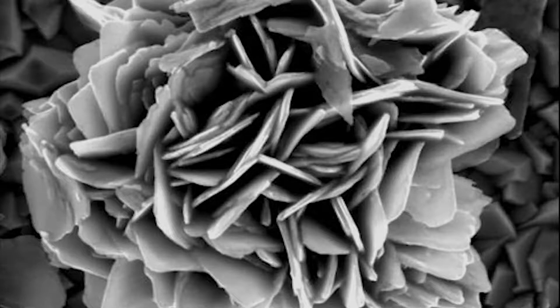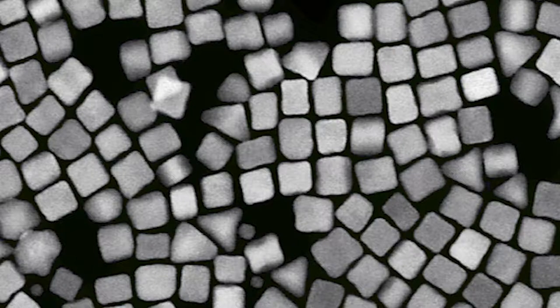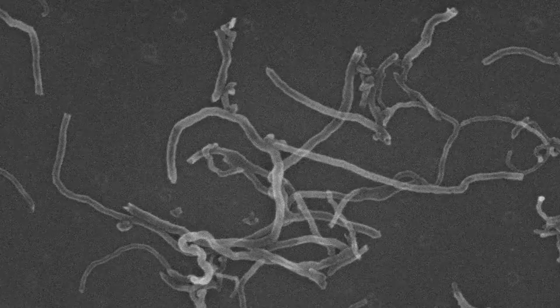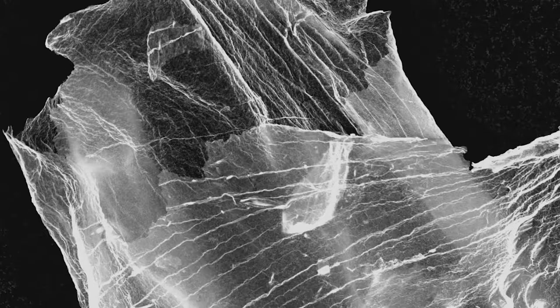Examples include nanospheres, nanocubes, branch nanoparticles, nanotubes, nanorods, and nanosheets.